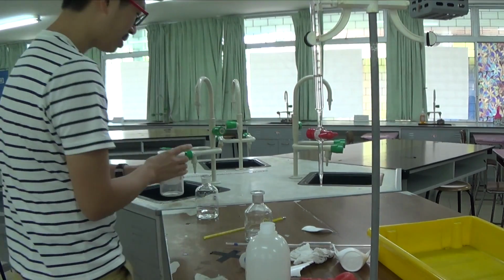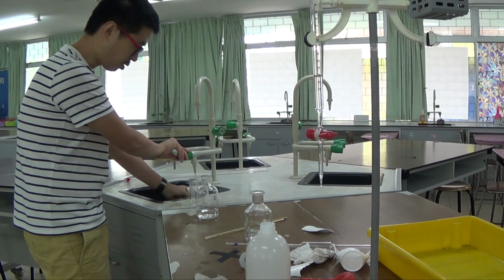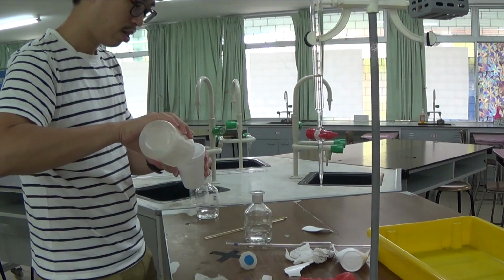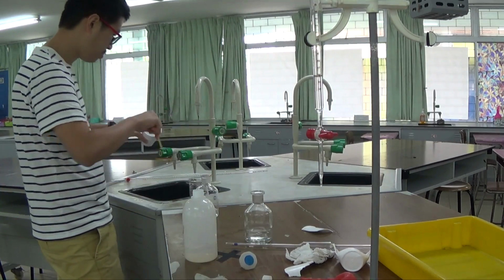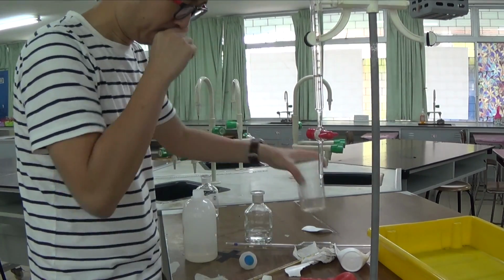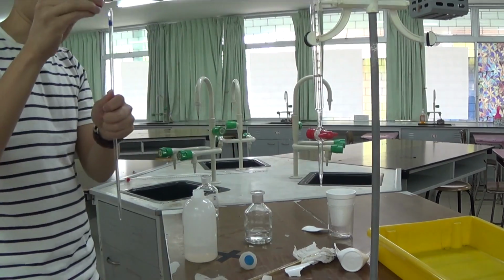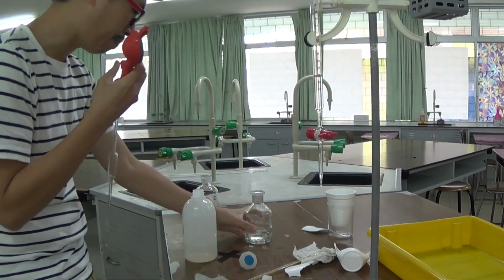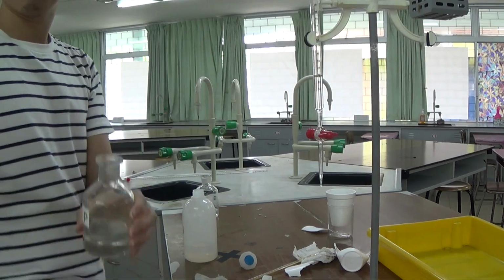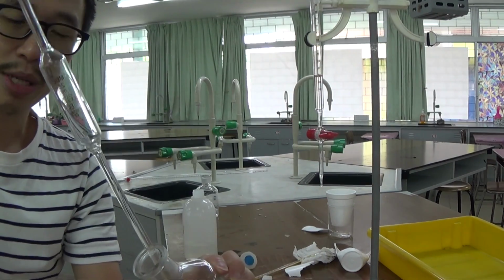Now we're on to the last thing that we're going to do. So just very quickly, rinse it with distilled water as well. Alright, okay. So the last thing I'm going to prepare out another 25 cm cube of solution P. Do not get your solution mixed up. It's going to be a disaster if you get your solution mixed up. This is P, potassium hydroxide.